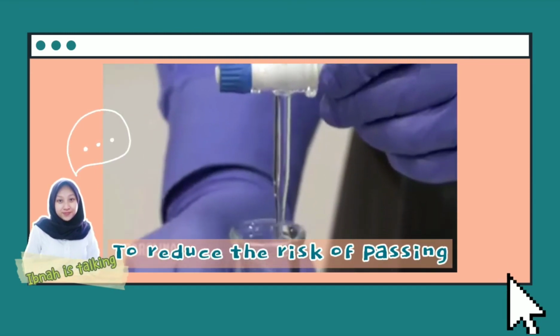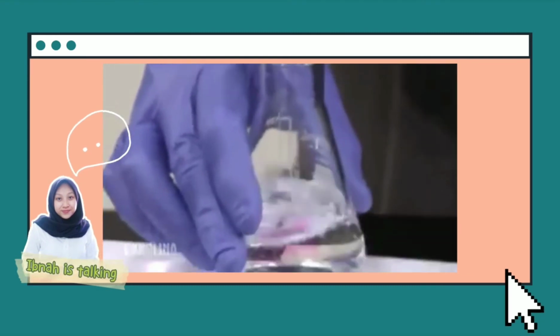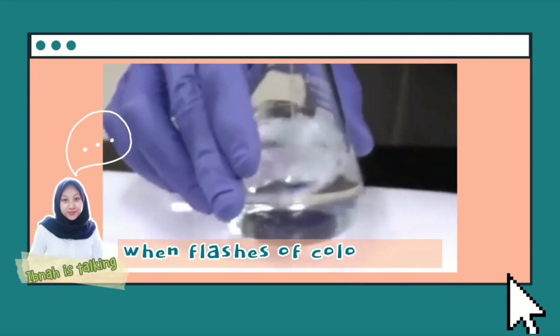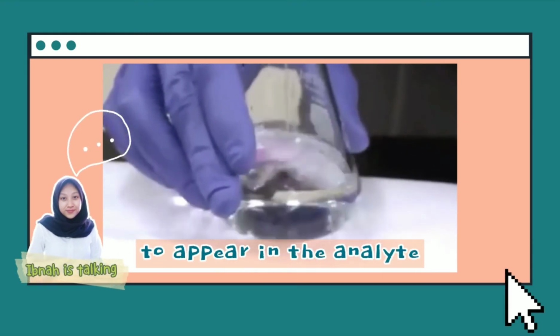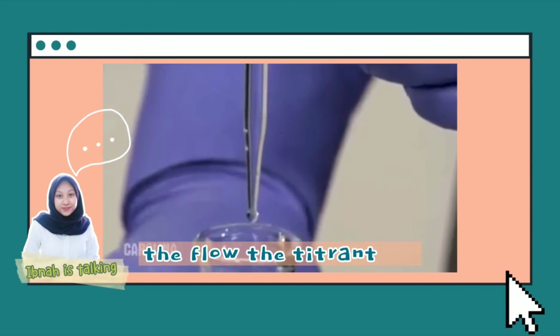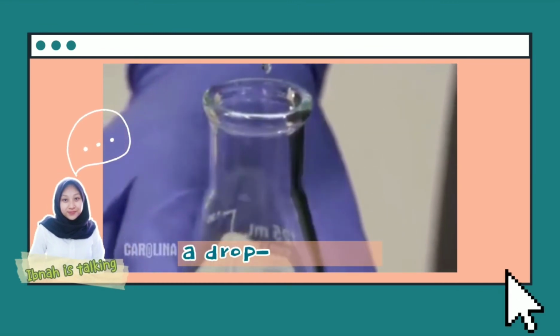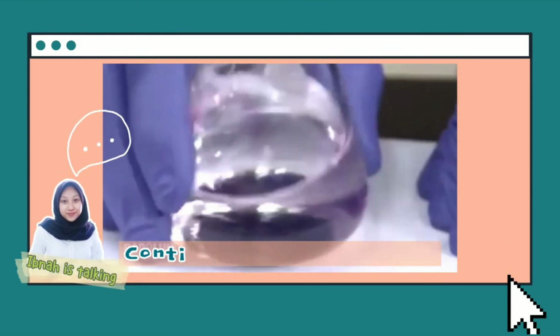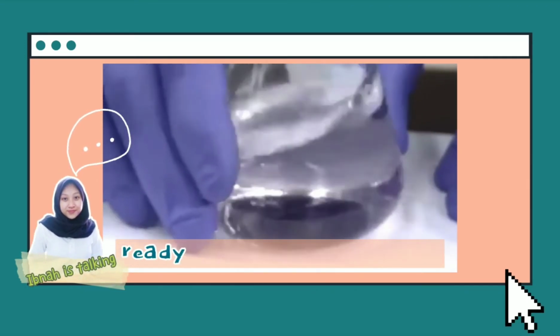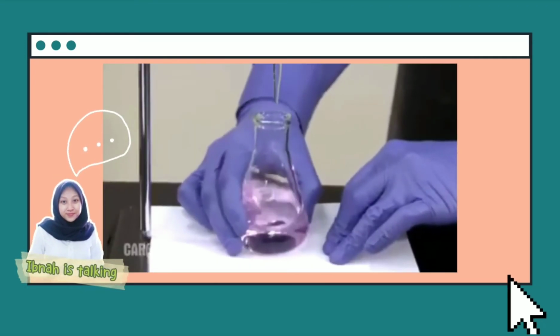To reduce the risk of passing the endpoint, slow down the addition of titrant when flashes of color begin to appear in the analyte. Adjust the stopcock to slow the flow of titrant to a drop-wise rate. Continue to swirl the flask with one hand and keep the other hand ready to close the stopcock.